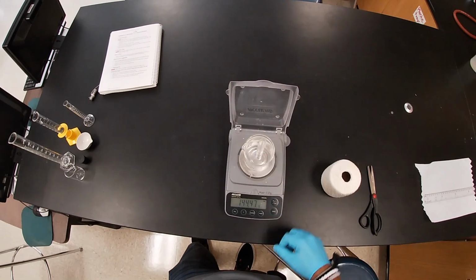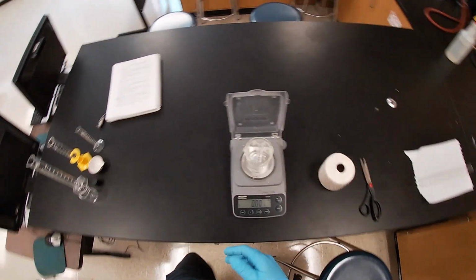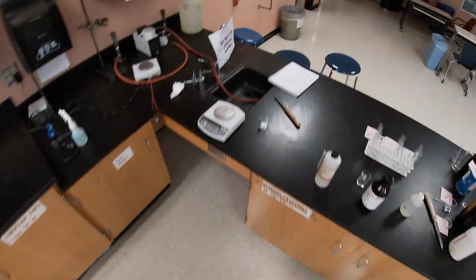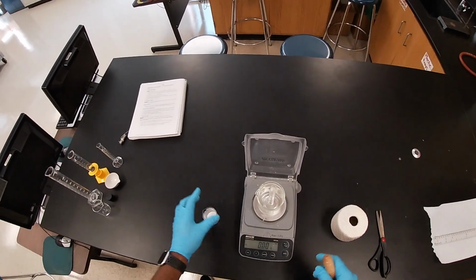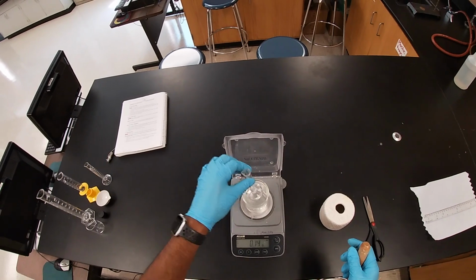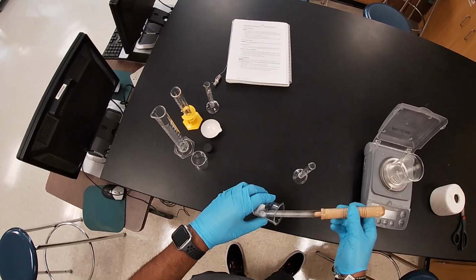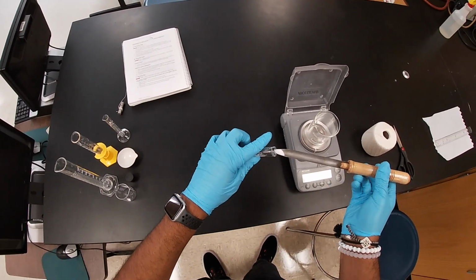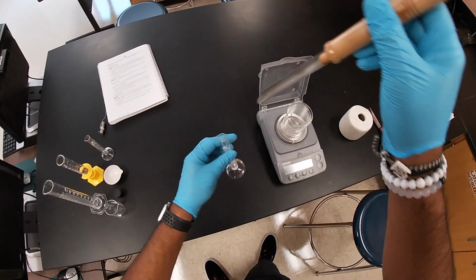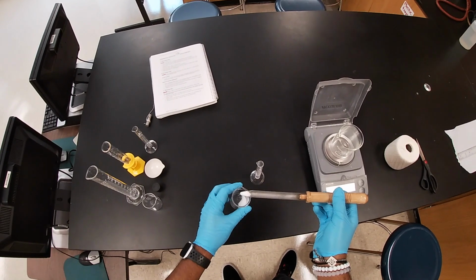We'll zero it out so that it takes it all entirely, right? And then the next thing we're gonna do is add our salt. So we know we have about 3 milliliters. Now we gotta determine how much salt we're gonna use, and we're gonna take out the amount. As we get the solid, we're gonna try to get it in as much as possible. And then we'll determine how much volume it goes up.